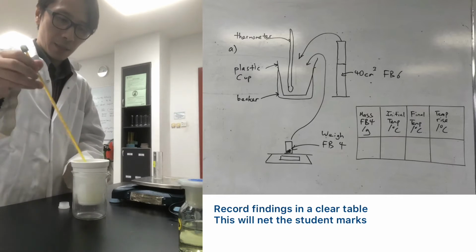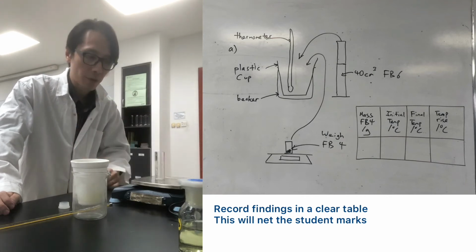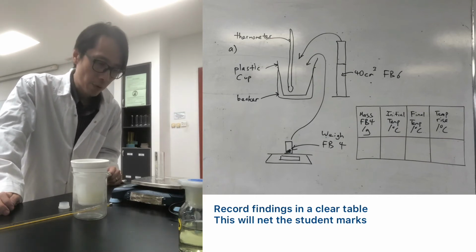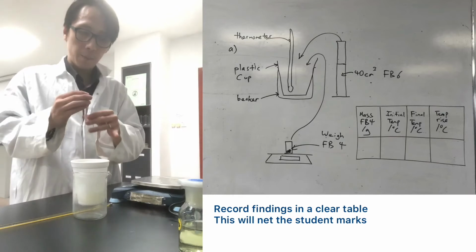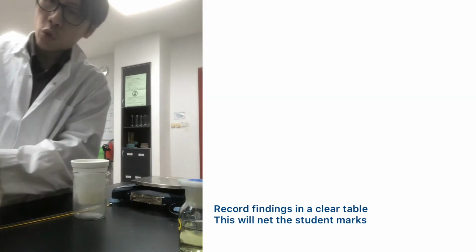Now after that, you can remove this. You have to weigh the empty tube without the stopper. I did it without the stopper just now, so it's without the stopper now. 13.4. So I have 15.5 minus 13.4, and you can just put it in the table and calculate the actual mass. Yeah. 2.1 grams of the FB4 being used for this. Okay, so that's for experiment 2A. Then there are some calculations which we'll go through in a separate tutorial.